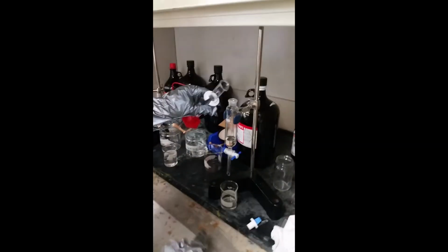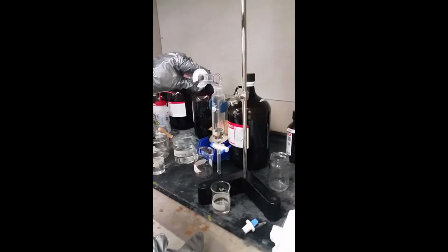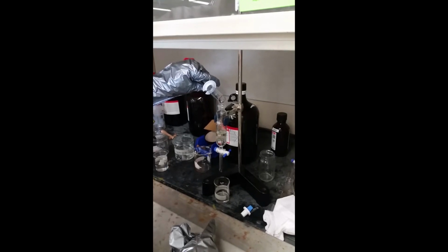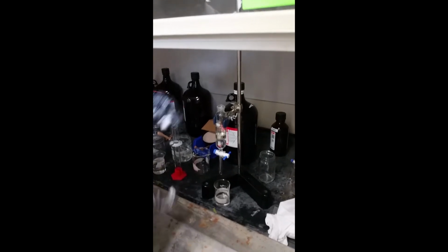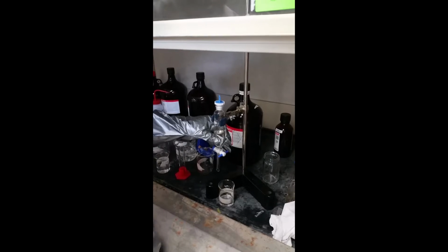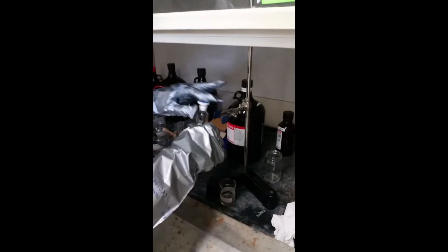15 milliliters of dichloromethane are added to 15 milliliters of the aqueous caffeine solution. Dichloromethane is more dense than water is, so it settles at the bottom. The cap of the separatory funnel is placed securely on before the separatory funnel is taken off of the clamp. The cap is held securely for the inversions. In this particular video, 3 inversions are done.